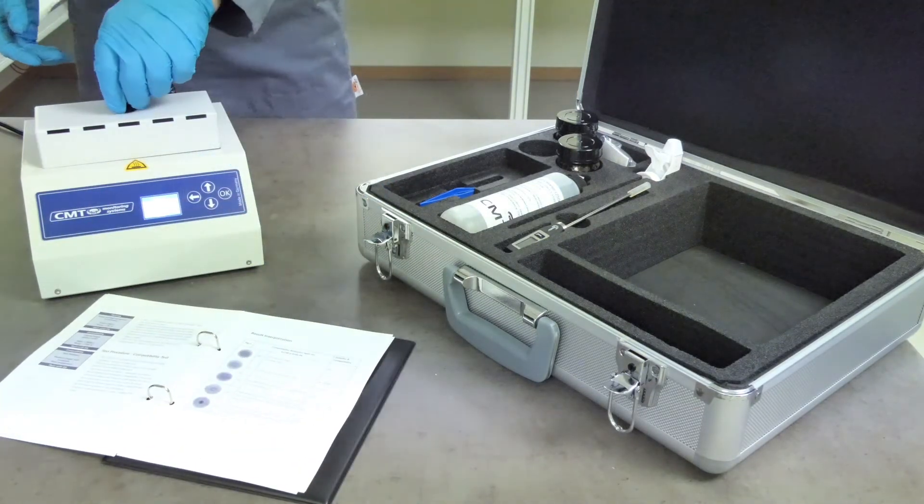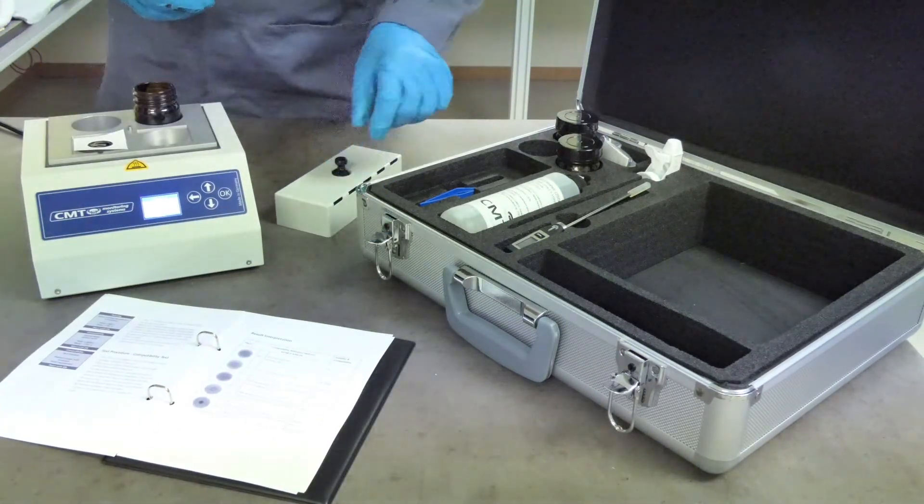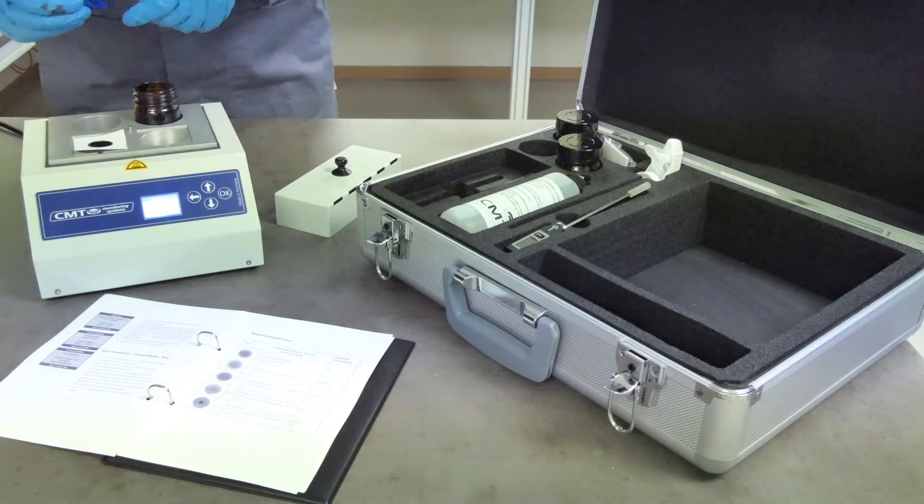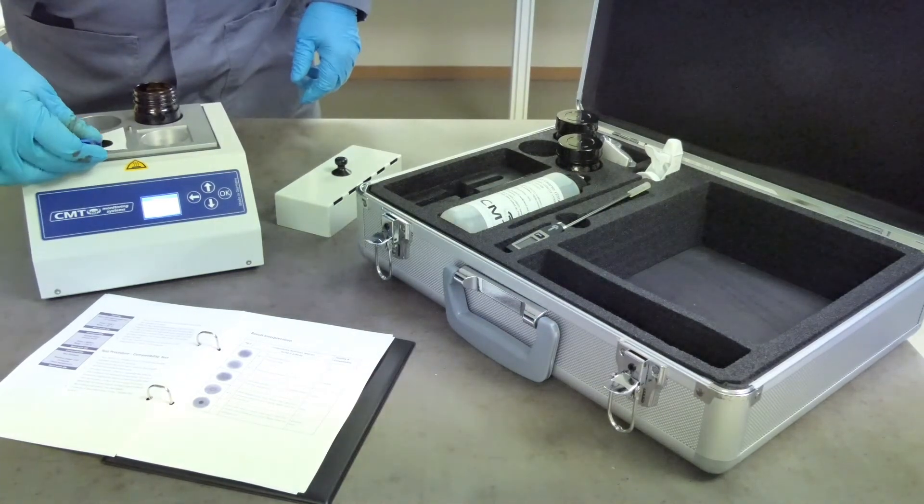After one hour remove the cover from the heating plate. Remove the test paper using the tweezers provided.